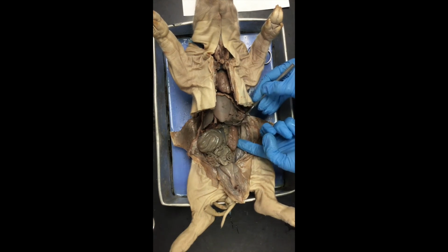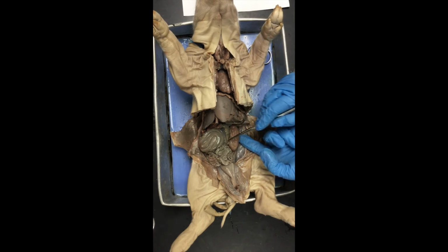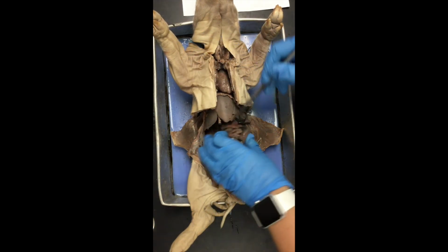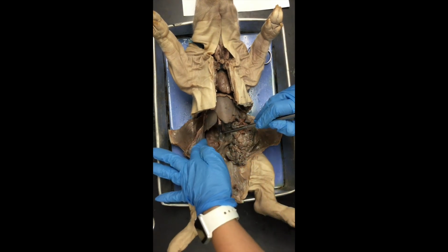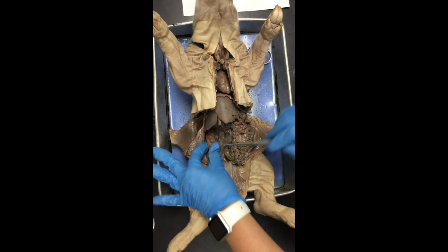You can see it's a solid organ. Here on this side would be the left kidney. You always go by the patient's right or left, so this would be the pig's left kidney. And if we roll the intestines over here, I've removed the peritoneum from this kidney as well. So here is the right kidney. Now, sitting just medial and superior, a little bit above the kidney, are going to be the adrenal glands.